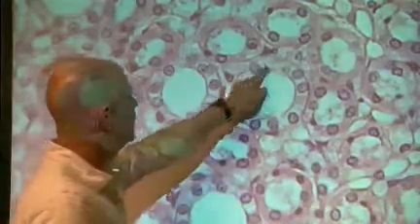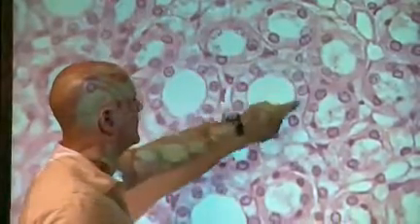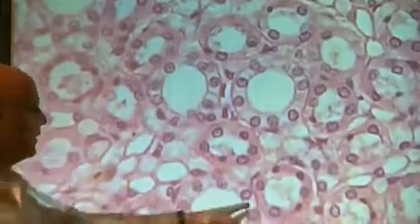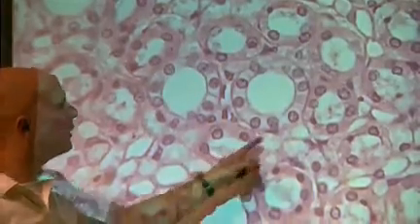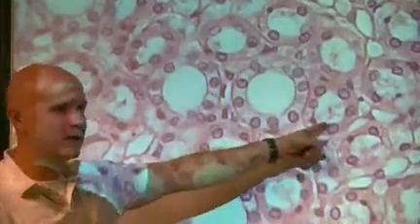So when you see a tube looking like this, where you get that simple cuboidal epithelium showing up very nicely here, right? You see it shows up nice here, nice here, nice here on this one. Not so great on this one, right? Not so great here, not so great there, right? You guys seeing the difference between this tube and this tube, this tube and this tube?